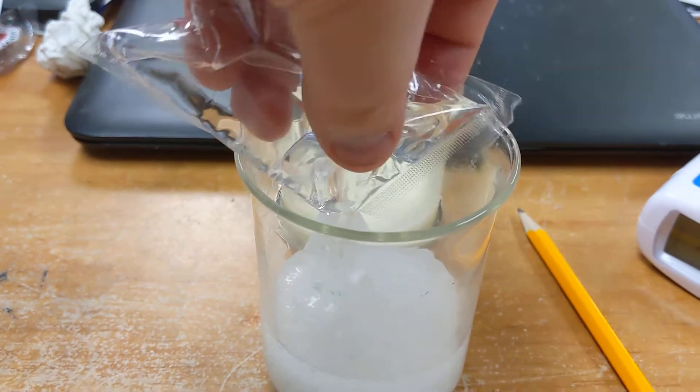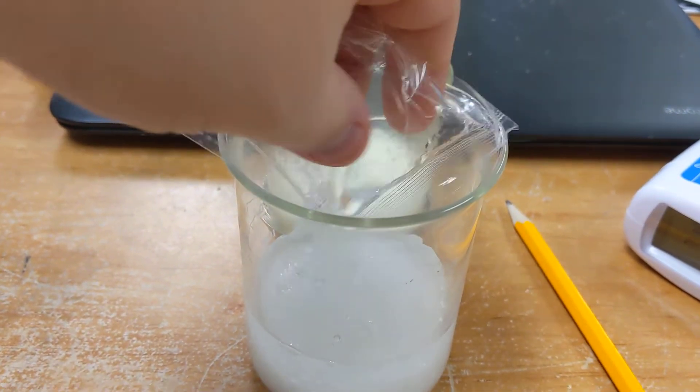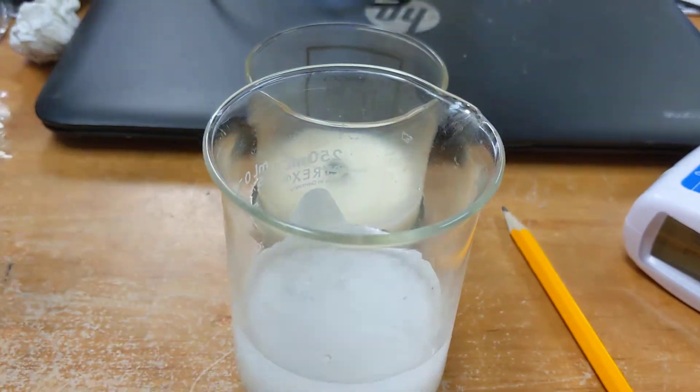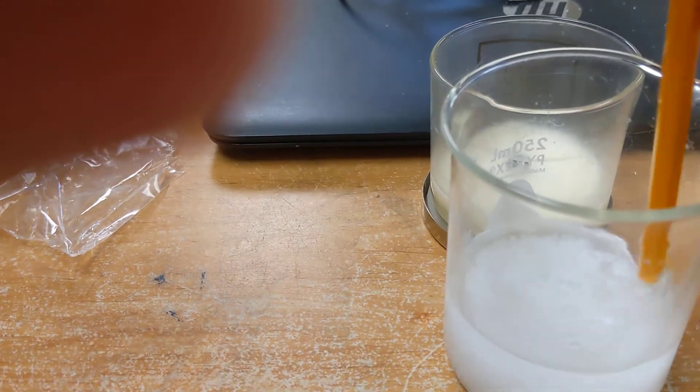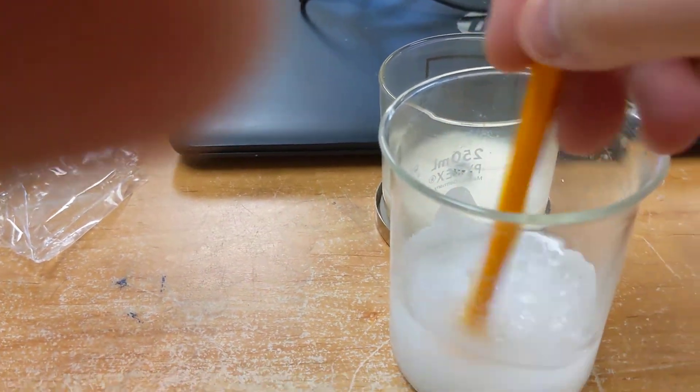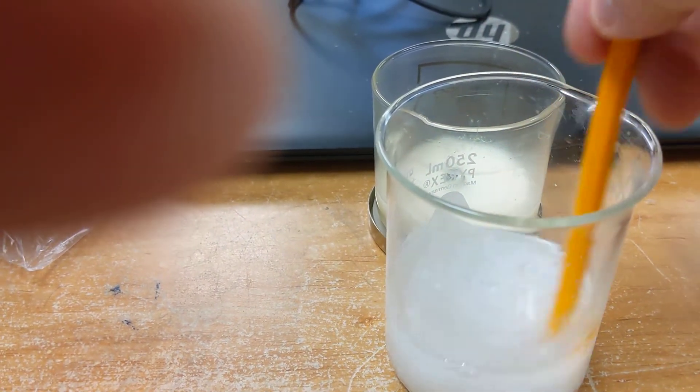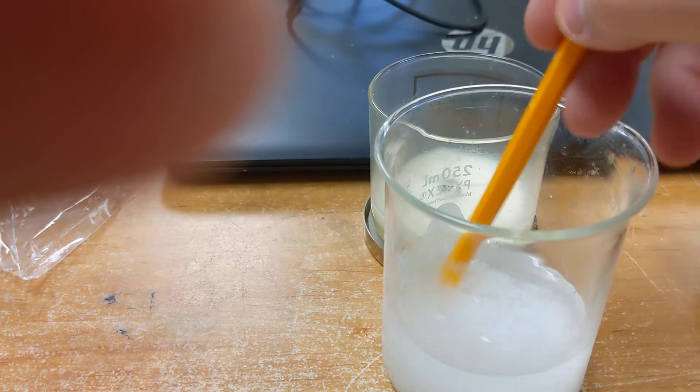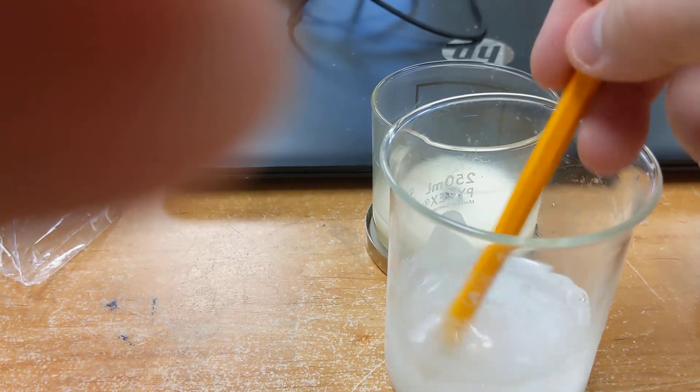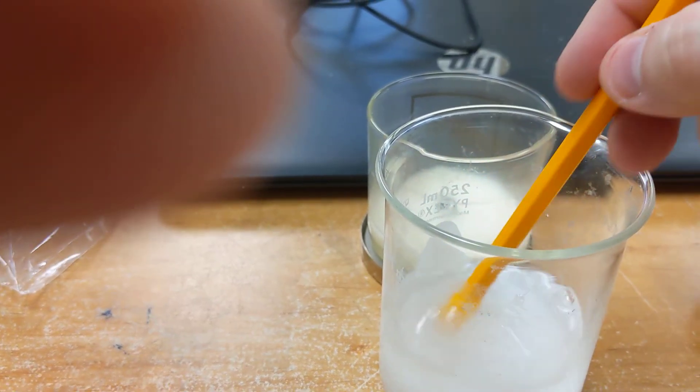Being mixed and poured into the urea, and we're going to give it a good stir. As the urea dissolves, it will react. We might see some bubbling here because CO2 will be produced. We may not, depends on how quickly this happens.